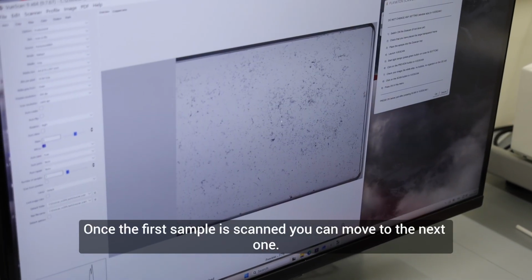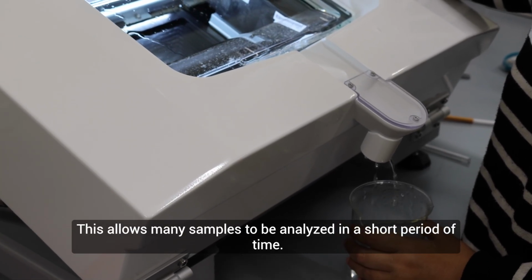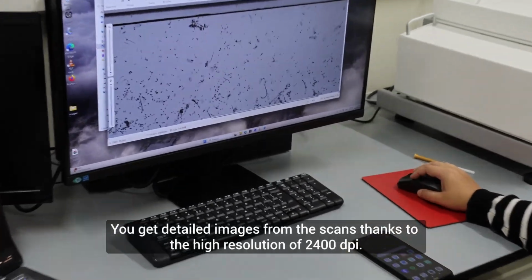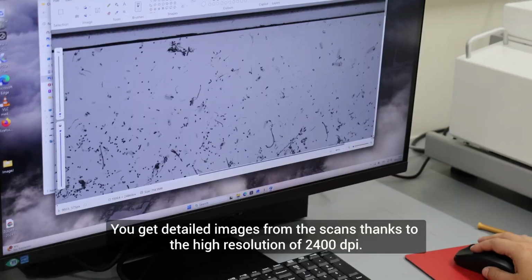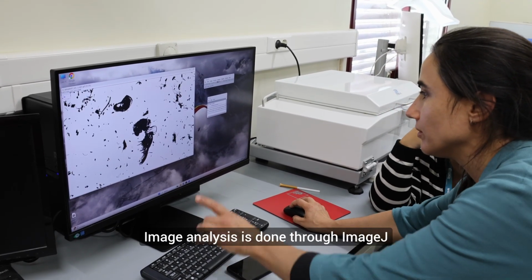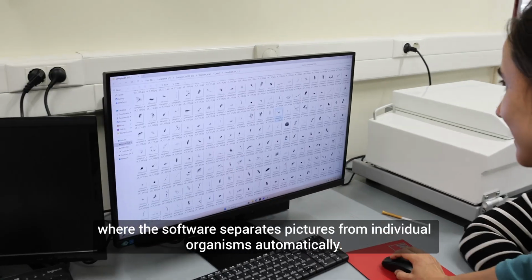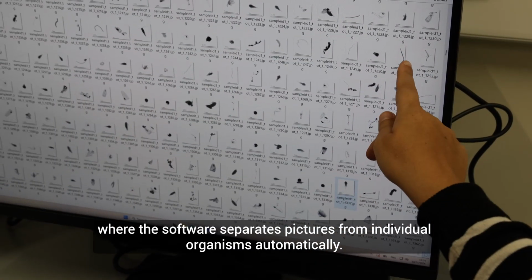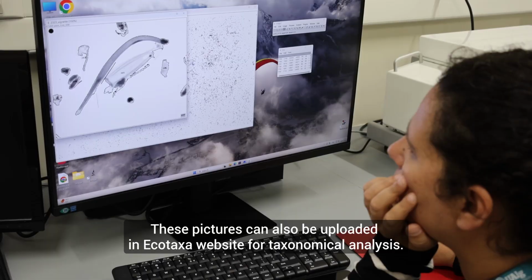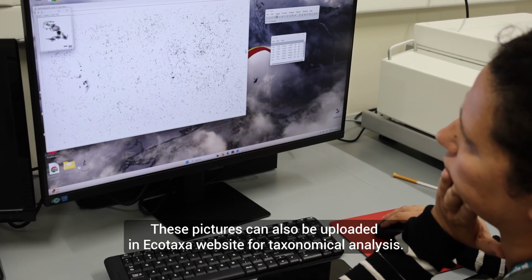Once the first sample is scanned, you can move to the next one. This allows many samples to be analyzed in a short period of time. You get detailed images from the scans thanks to the high resolution of 2400 dpi. Image analysis is done through ImageJ, where the software separates pictures from individual organisms automatically. These pictures can also be uploaded in EcoTaxa website for taxonomical analysis.